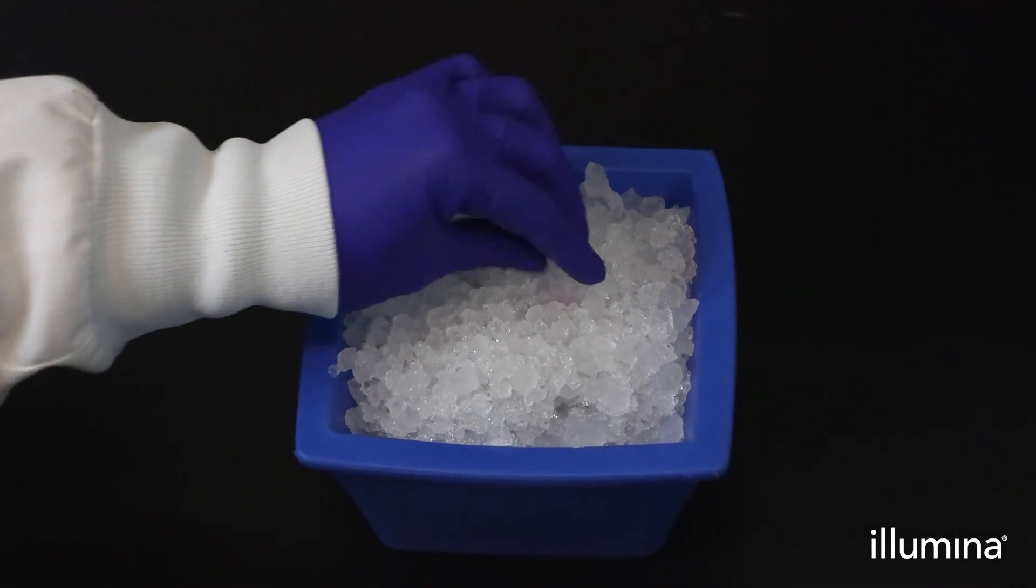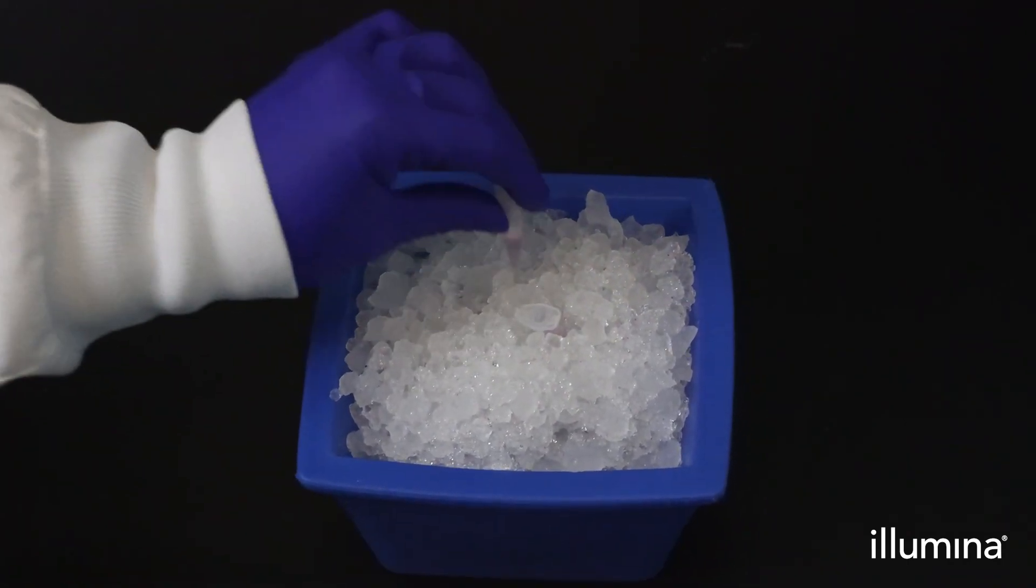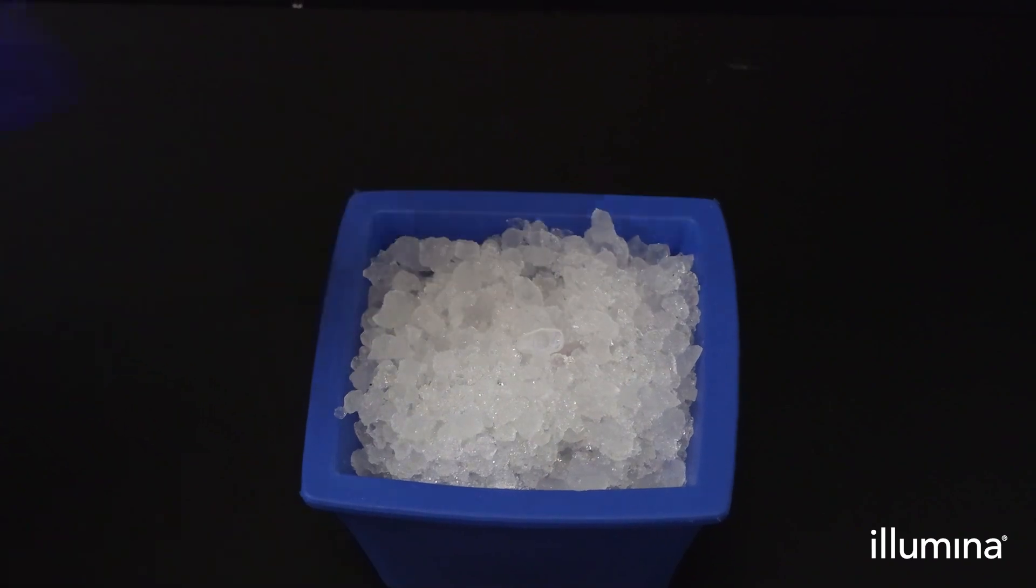Once you've removed all the pink waste, your samples can be placed on ice and you can move on to the washing section of the user guide.